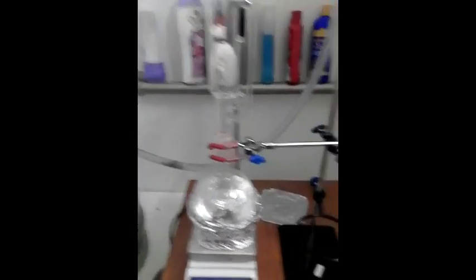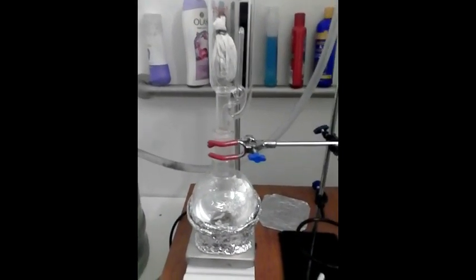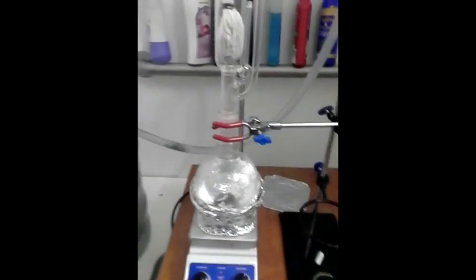I got my water there. Let's go ahead and turn on the fan. There's some ventilation going in here because that is a solvent and we don't want any buildup anywhere. And there's my fire suppression apparatus.